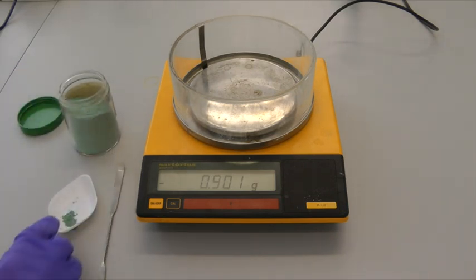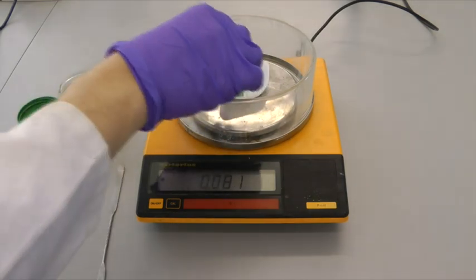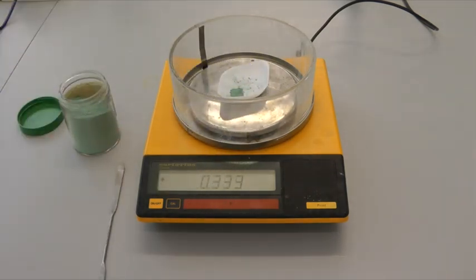The weighing boat can then be placed on the balance to take a first reading. This process should be repeated until the required mass is obtained.